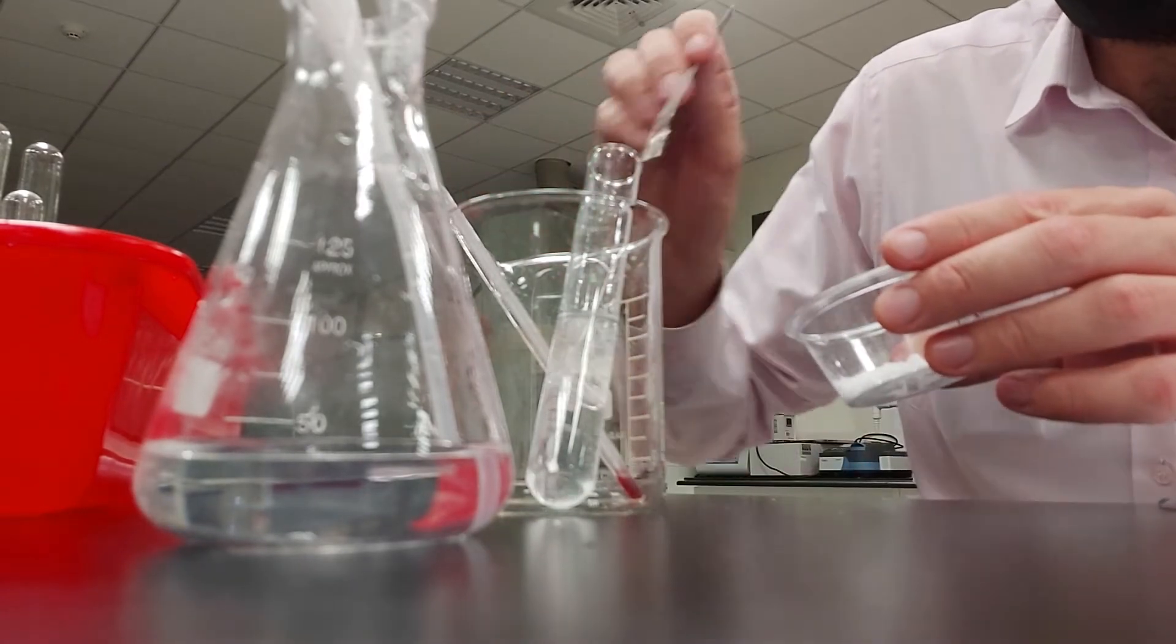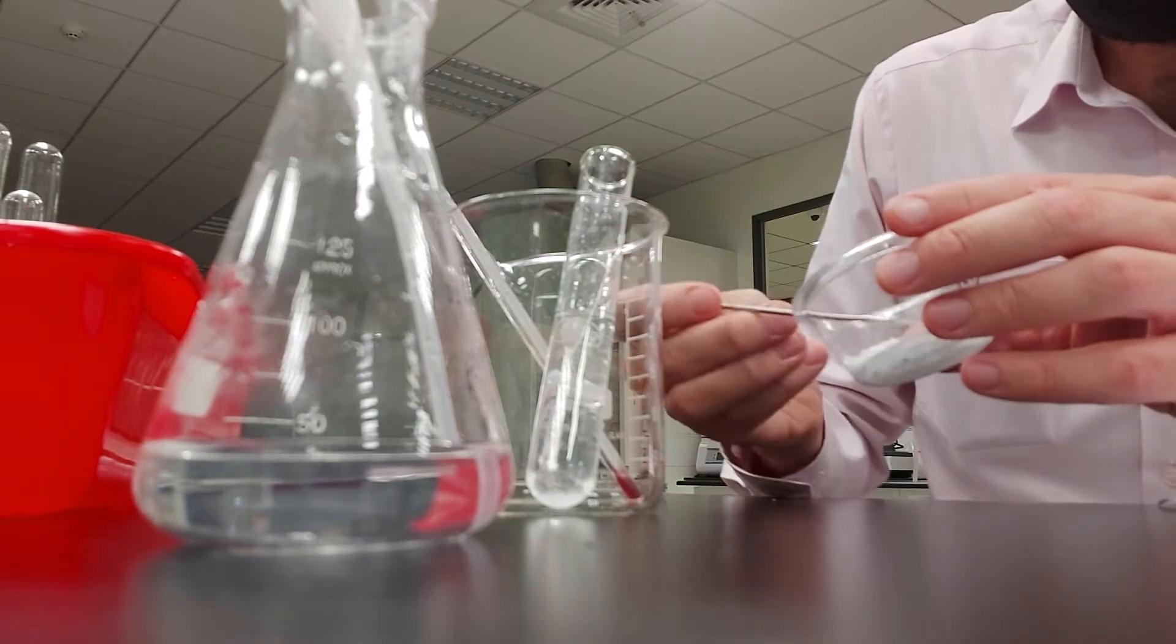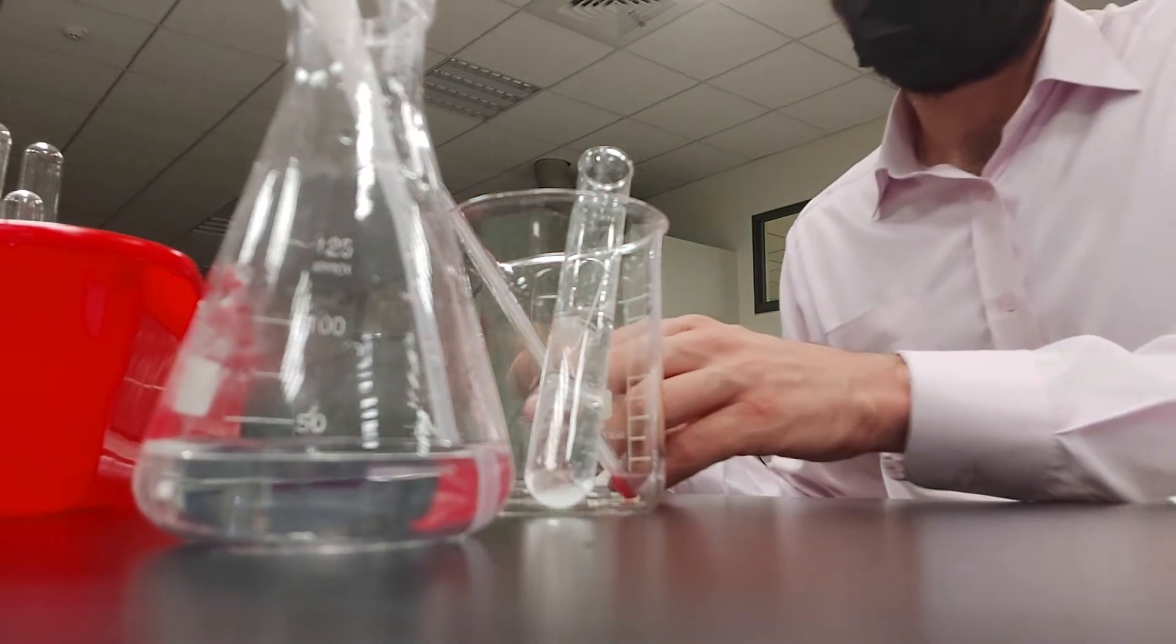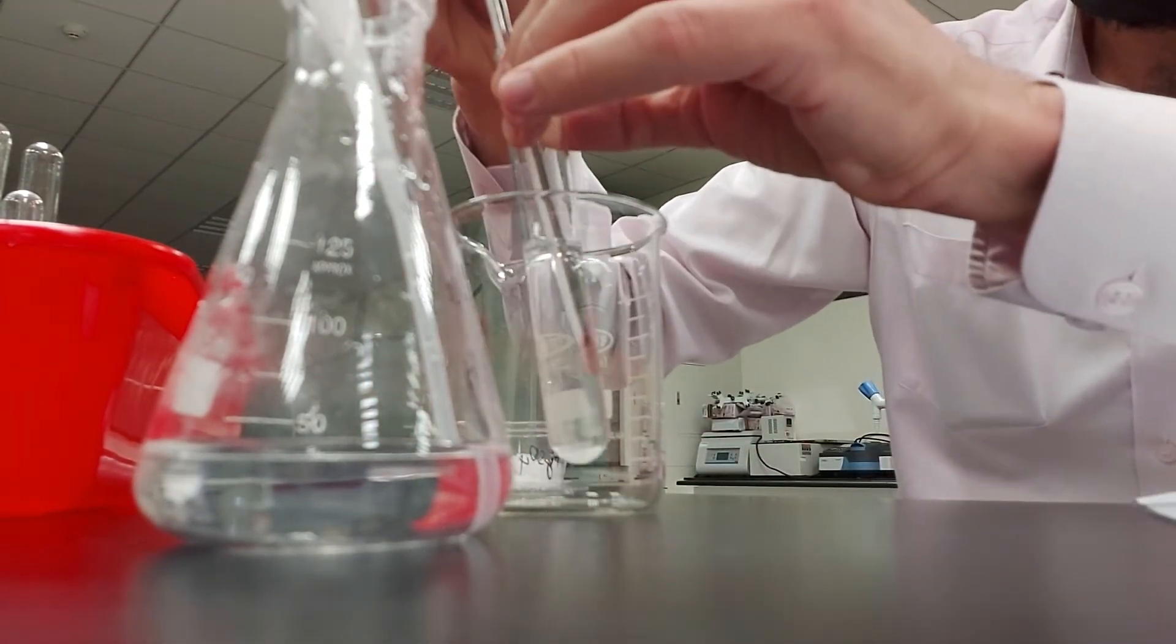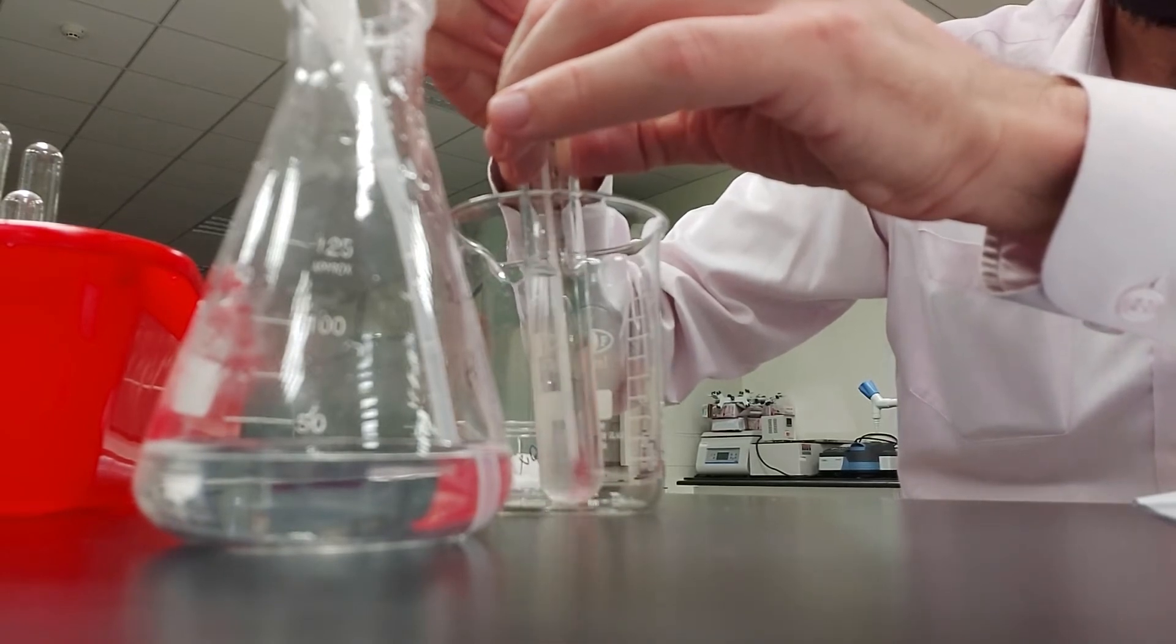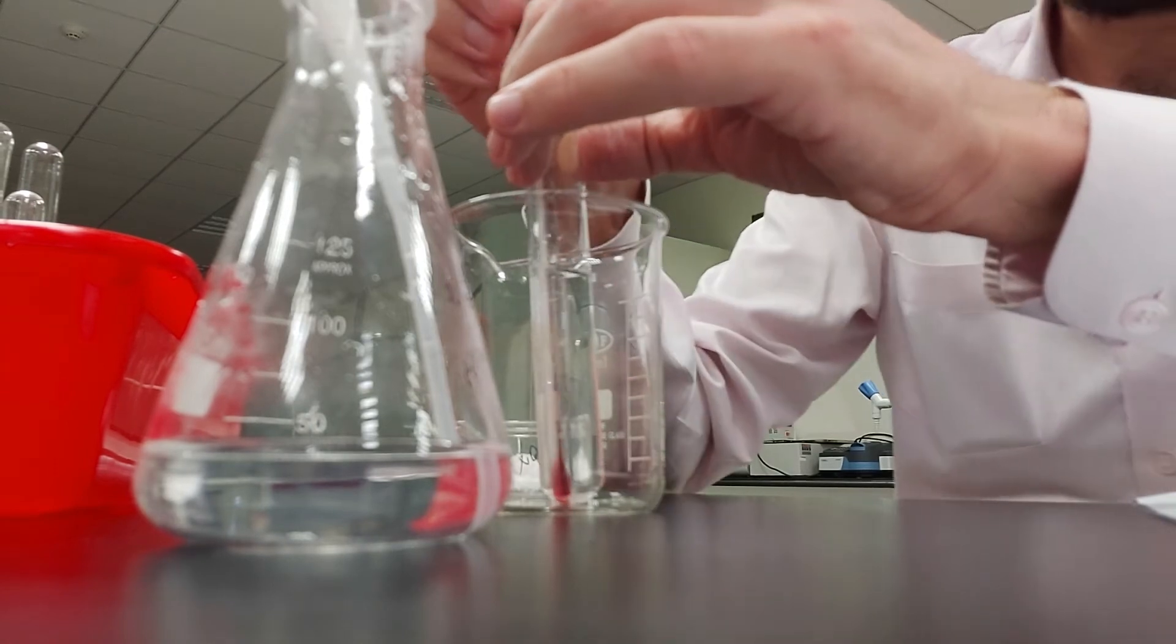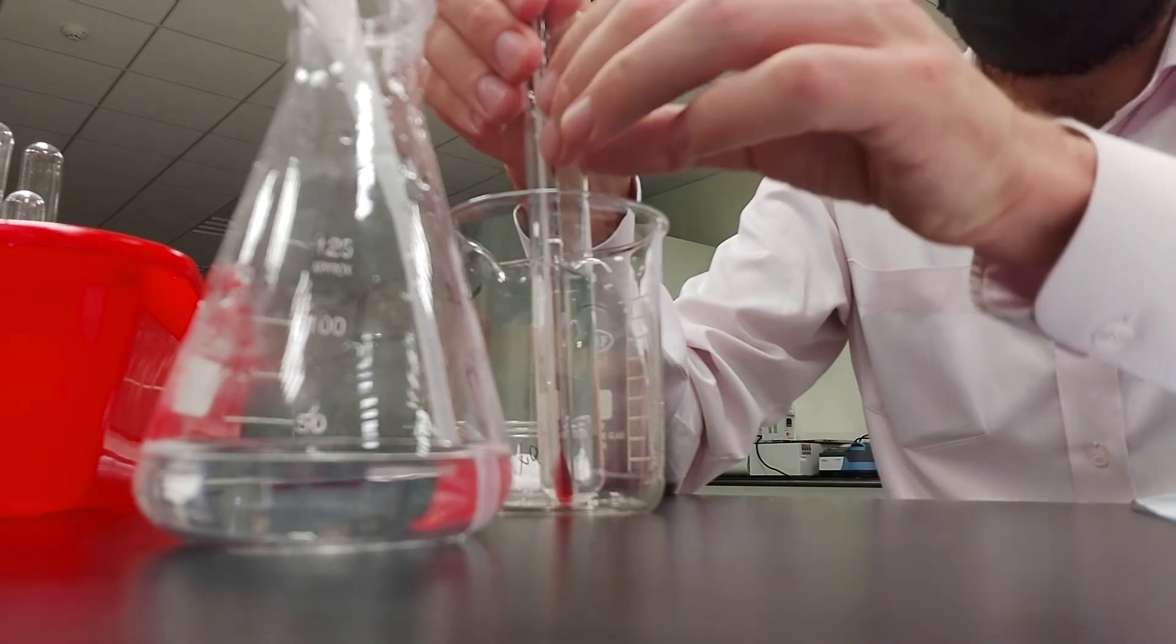A little bit more. I'm going to put our thermometer back in there. I'm just going to wait a second while we let the reaction occur.